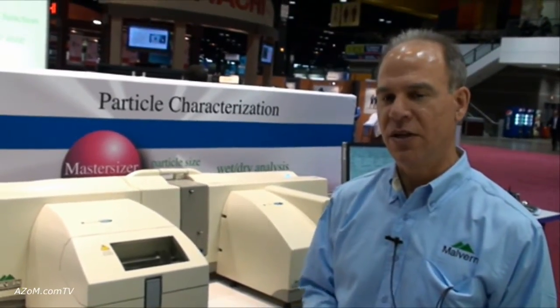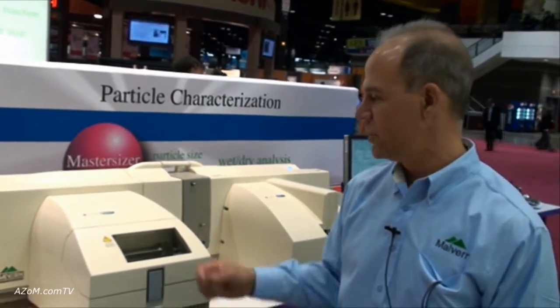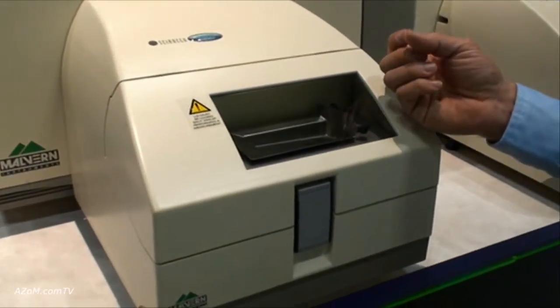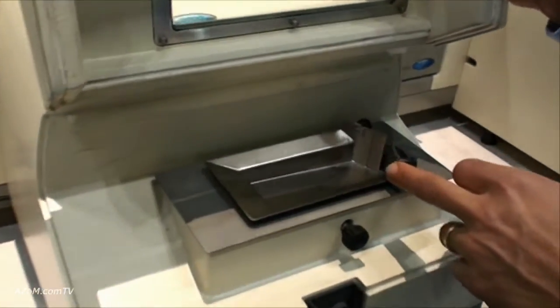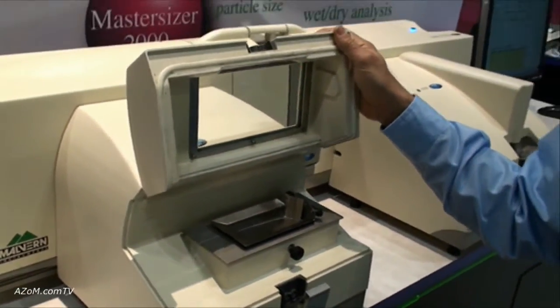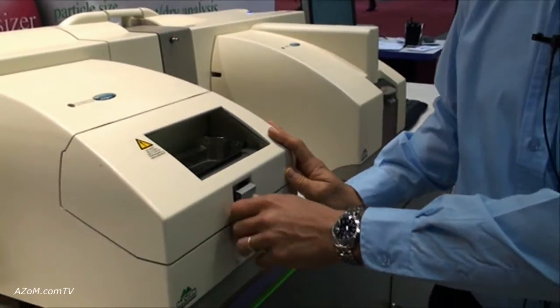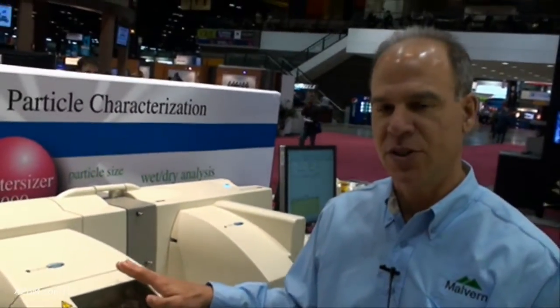We also have a range of particle dispersers. This is a Scirocco, which is used for dry powders of any type. The unit is completely automated. You would open the cover and place your sample in this tray. This is our standard tray. We have other configurations available for applications such as the pharmaceutical industry, where you only have a very small amount of powder to work with. Once your sample is placed in the tray, this cover is closed and locked so the operator is kept safe from any possible toxic or active pharmaceutical ingredients that you might be working with.